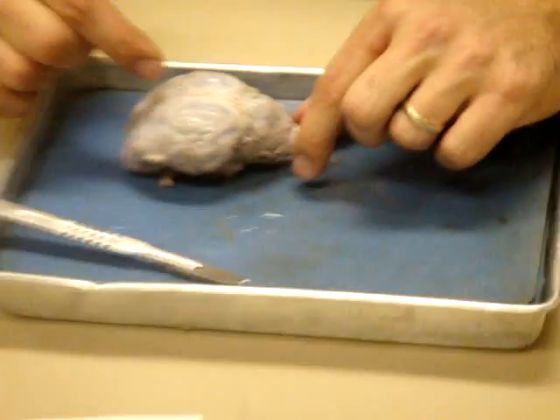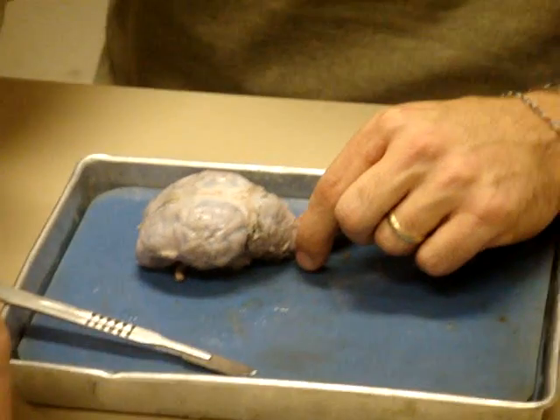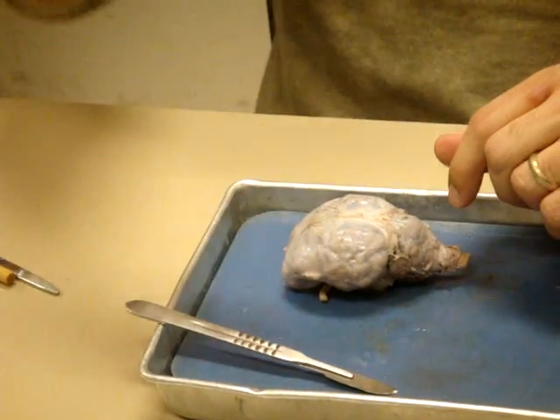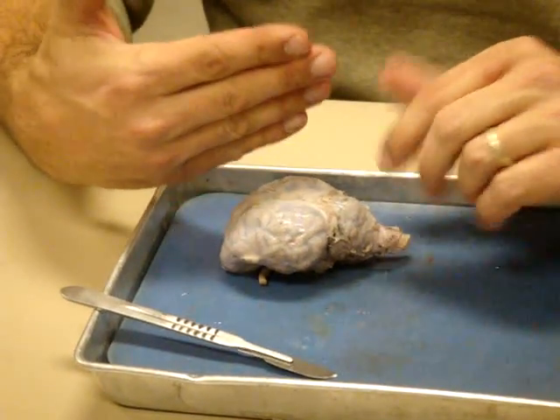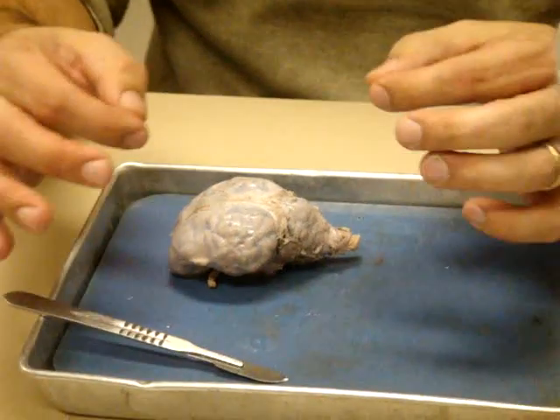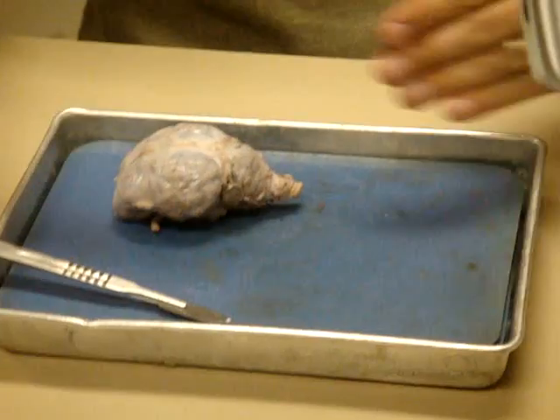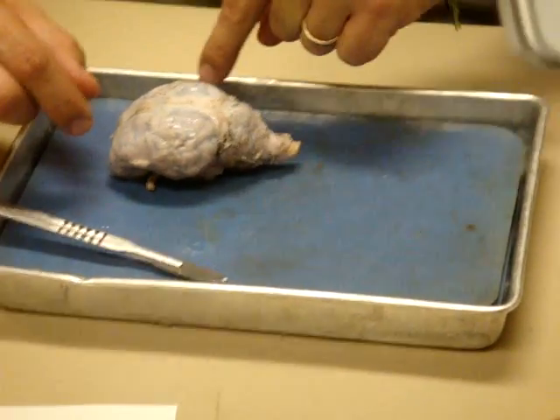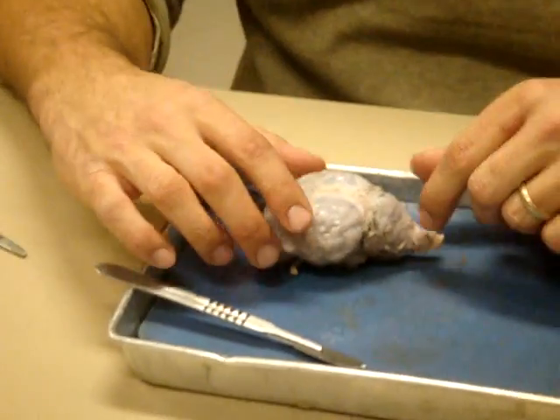Now, we also recall these terms. We brought them up in lecture. You see falx cerebri and tentorium cerebelli. I'll show those to you in a moment. But we see the continuation of the meningeal layer of the dura goes down between the two hemispheres. And it kind of is like a little separation. It's not that big in the sheep. I'm almost positive it's much bigger in the human and much more evident. It's that separation between the two hemispheres, a little extension of the dura. And then the one that extends down between the cerebellum and the cerebral hemisphere is called the tentorium cerebelli. We'll be able to see that one real clear.